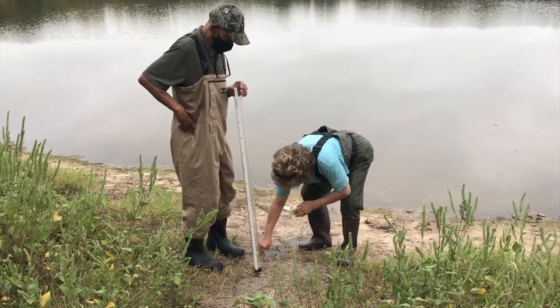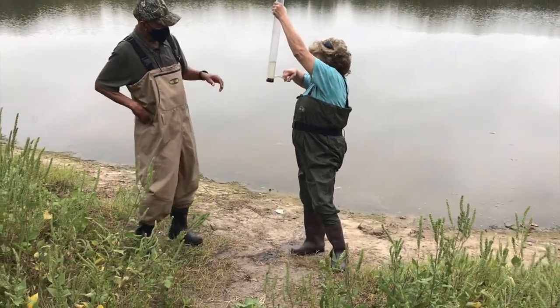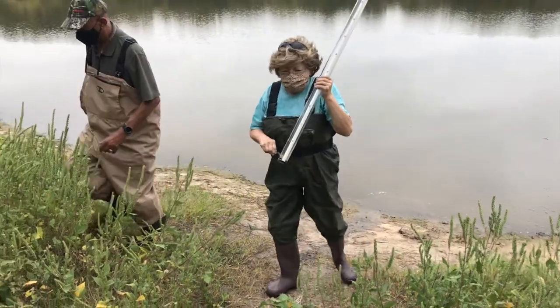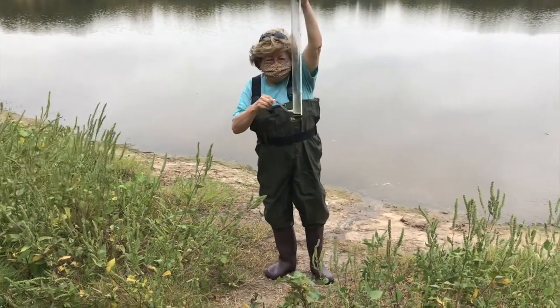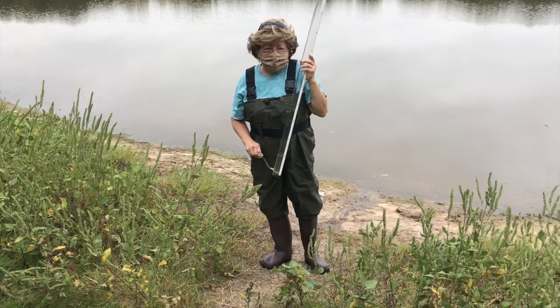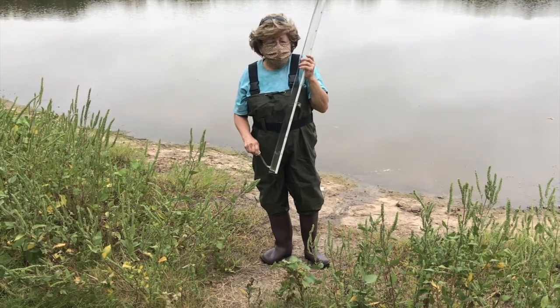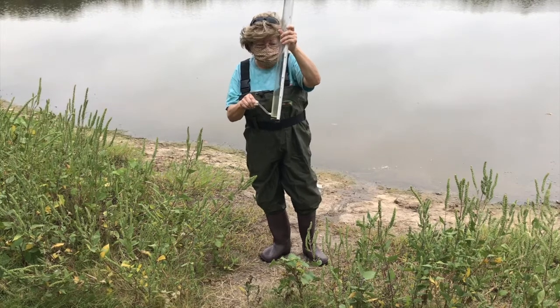Okay, right there. All right, let's see what we have. What do you read? It's pretty close to 10 centimeters. All right. So instead of having 85 centimeters of clear water, we've got 10. This water would be disastrous if you were to drink it. It would make you terribly sick. It would give you weeks and weeks of diarrhea, if not kill you from dehydration. This water is not safe to drink.